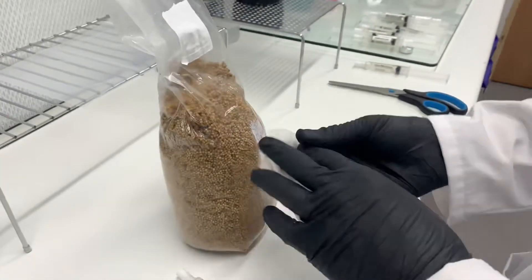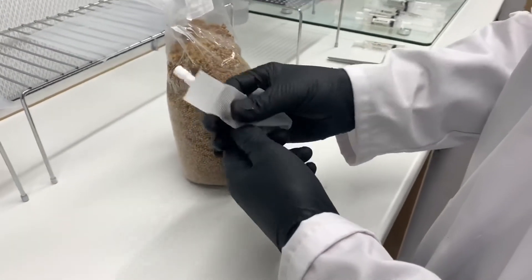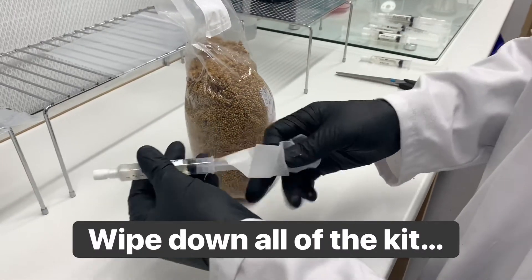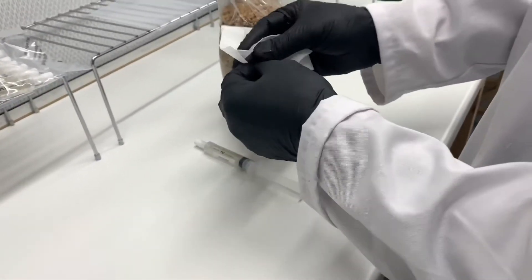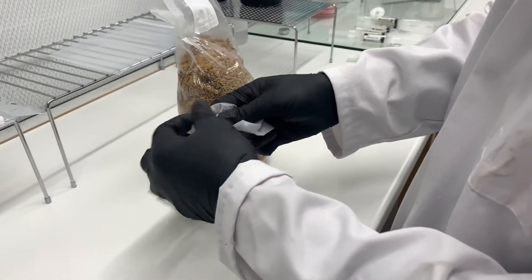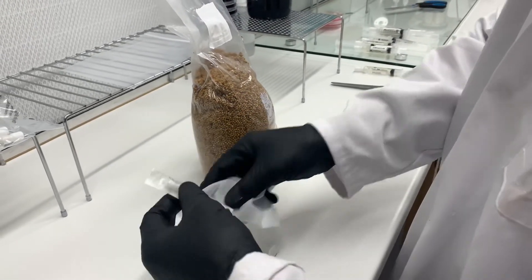That's it, wonderfully shiny. Obviously we're doing this in front of a flow hood, but you really just don't want to be doing this in a room where there's loads of airflow. So don't sit in there with an open window or something like that. You just kind of want it in a room with no airflow.